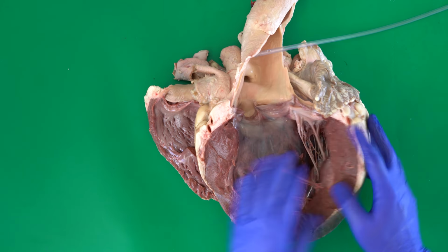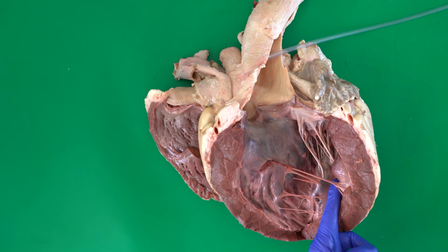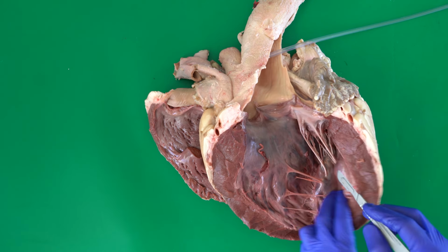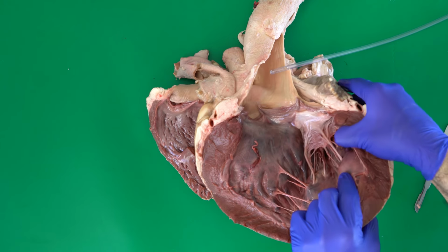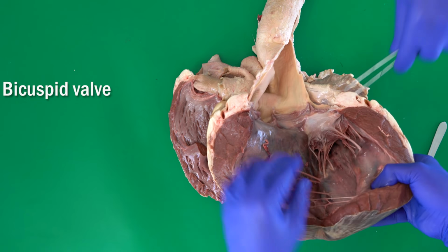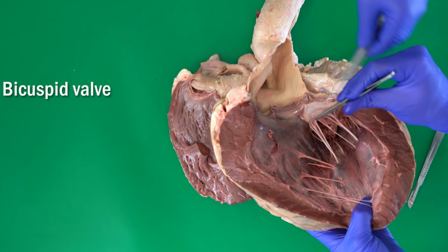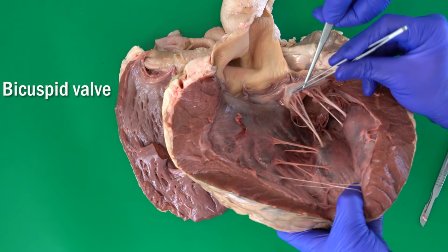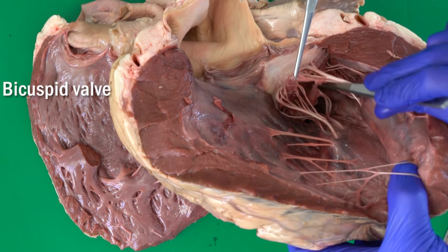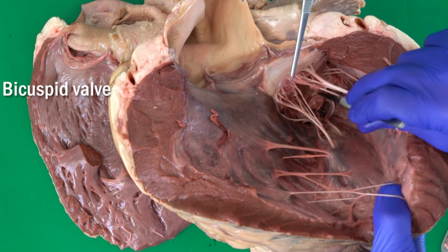Okay, let's go back to the left ventricle. As I said before, I would like now to show you the bicuspid valve. Perhaps I can keep this here, but let me cut this one, and I will try now to show you the two cusps of the bicuspid valve. So this is one, and that is another one here, if you can see it. So we have just two cusps here.